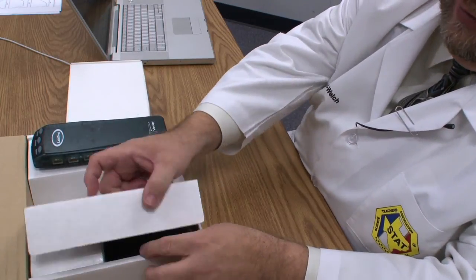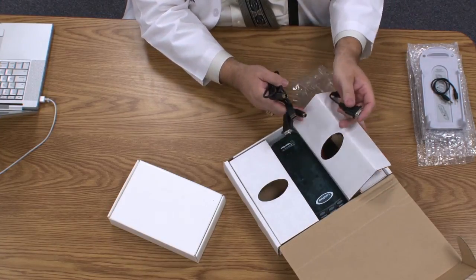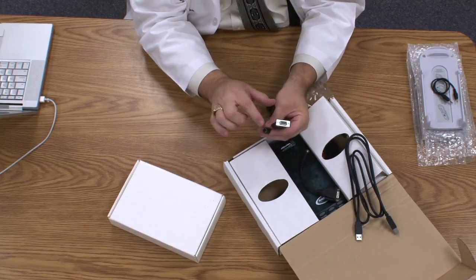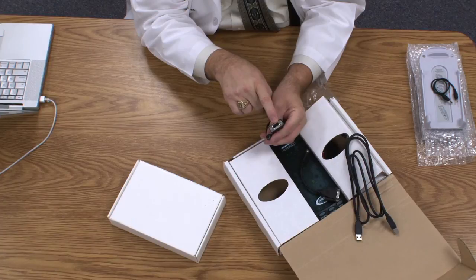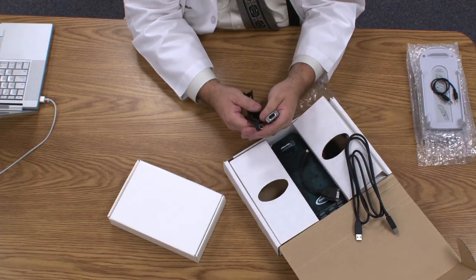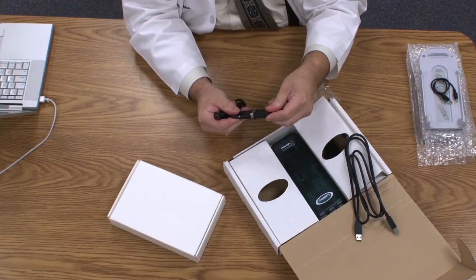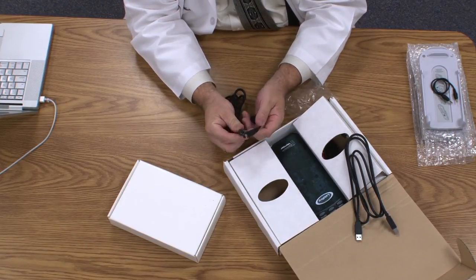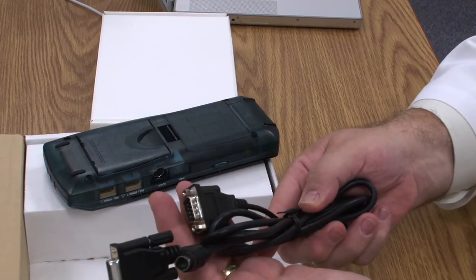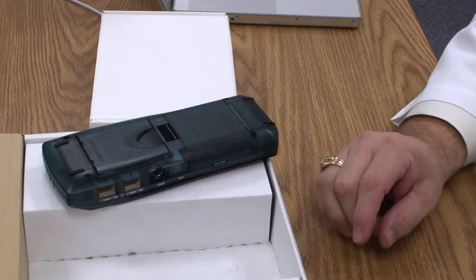That's all that's in the right-hand side. In the left-hand side, there's a whole mess of cables. You'll discover two long cables. The first one is a data cable that has a trapezoidal shaped plug on it and a round plug, and a little short cable with a round plug and the mating plug. These were designed for computers that had IO ports and for the Mac IO port. They plugged into the side of the LabPro. None of our computers anymore use any of these in or out ports, so these two cables — the little one and the big one with the tall heads — can be thrown away. Trust me, no one has any use for those.